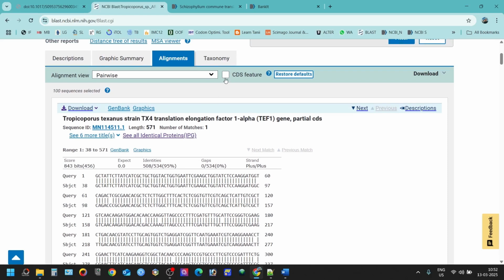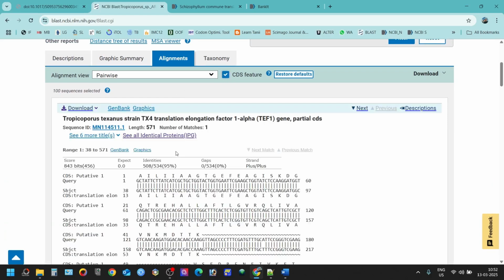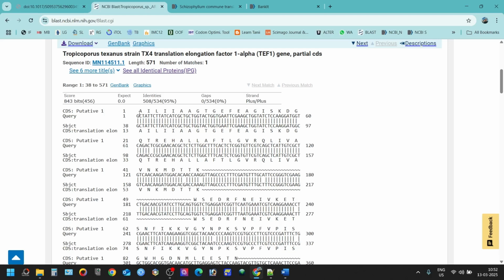Now you have to click this CDS function features here. When you do that, you will find that this is showing all the protein coding sequences, genes which are coding these proteins, A, I, L, all this alanine, whatever the guanine, whatever it is, this is coding all these amino acids up to this three sequence.